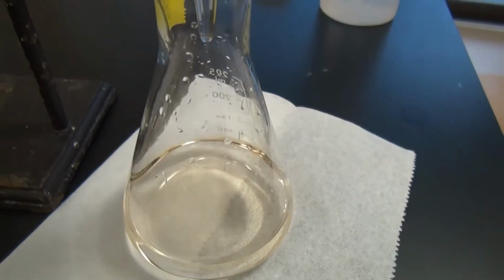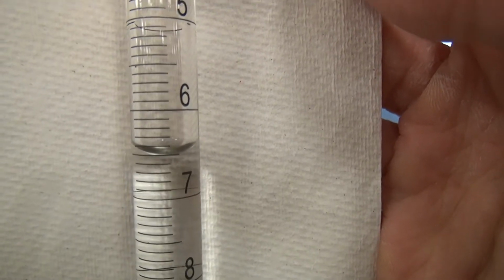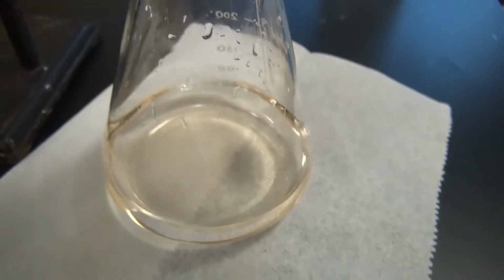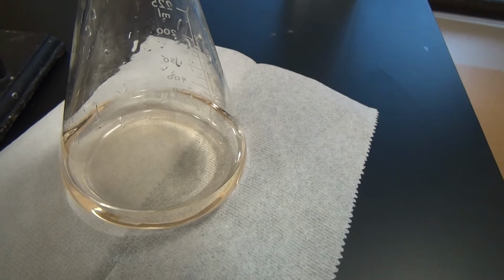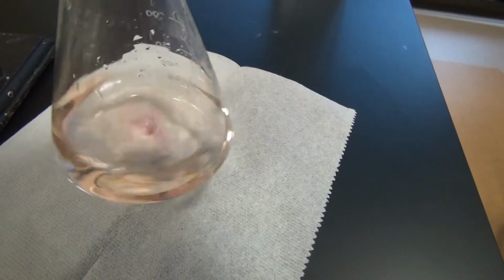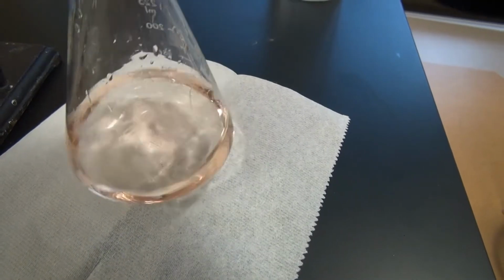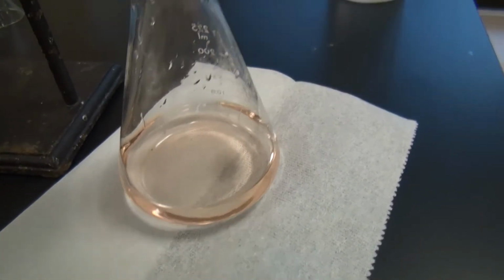Okay, maybe we got one more drop. Okay, that is the end point.